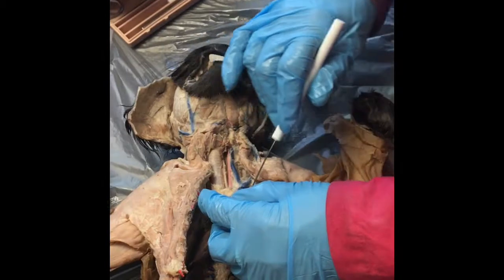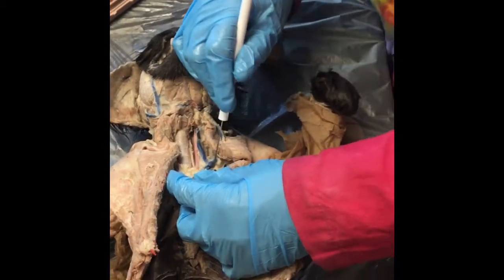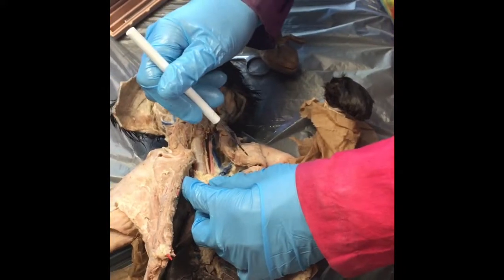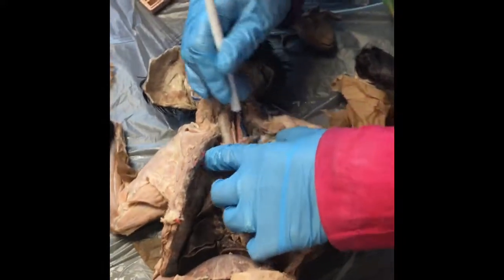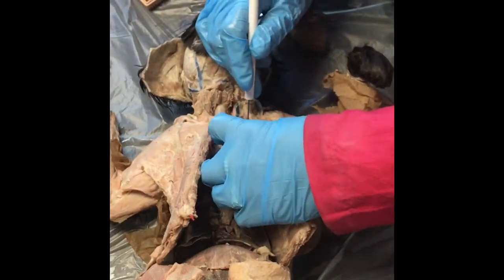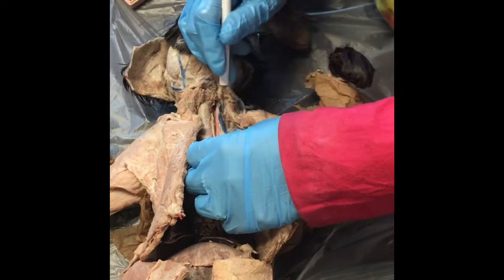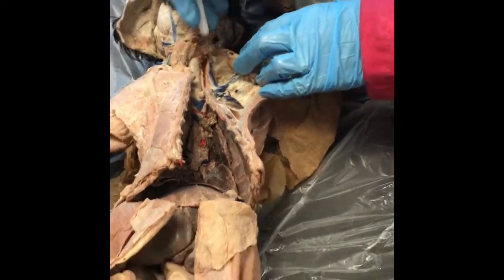All right? Then what ends up happening is, you see how this is torn off right here? That's going to lead, and I will have it much better in another cat, that's going to lead to the subclavian, which is going to go out to the arm. See how this is continuing out to the arm right here, even though it's torn. Okay? Then this is going to lead to your jugular right here.